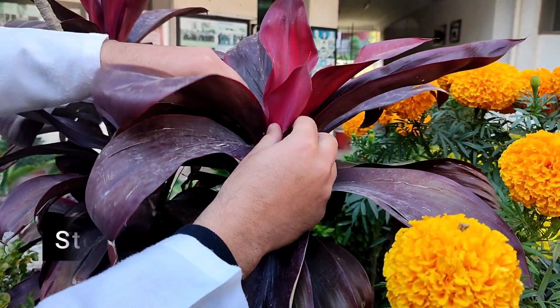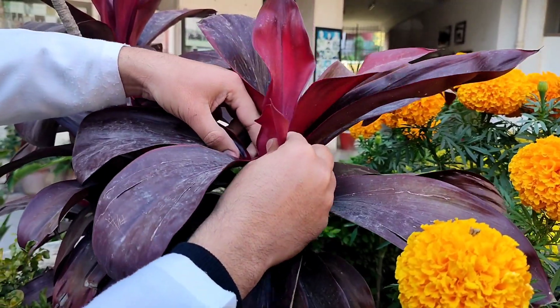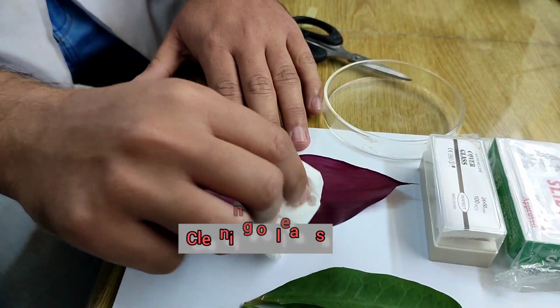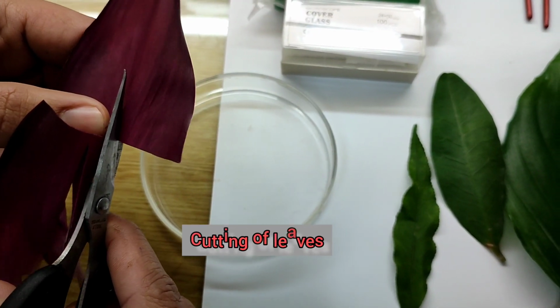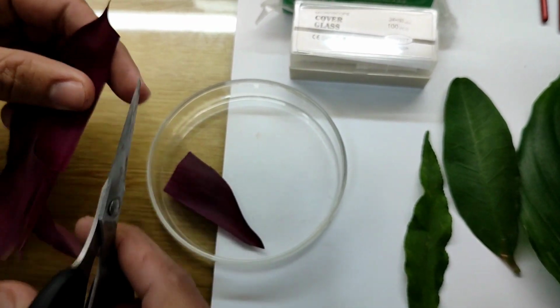The first step to study the leaf epidermal anatomy is the collection of the fresh leaf from the plant. So this is the first step, to collect the leaf. The second step is to clean the leaf with tissue. So this is the second step, to clean the leaf. The third step is to cut the leaf into small pieces before boiling. Here you see the leaf is cut into small pieces.